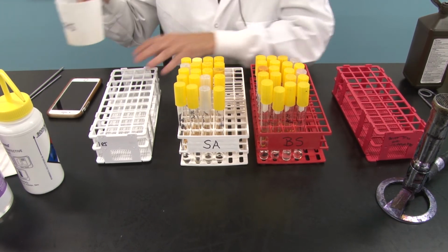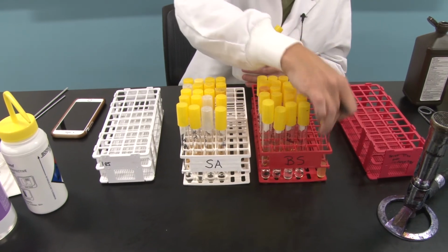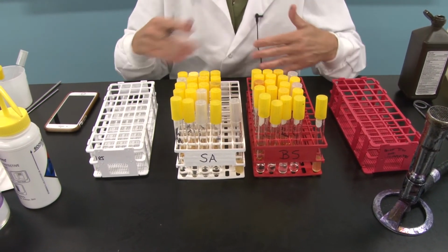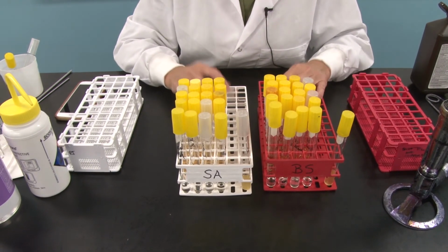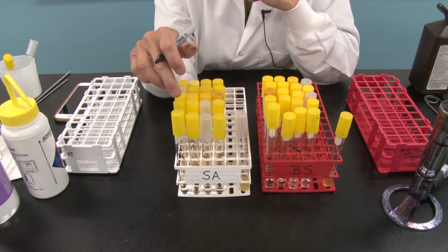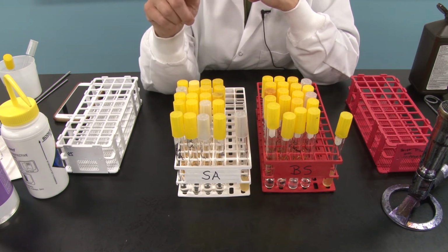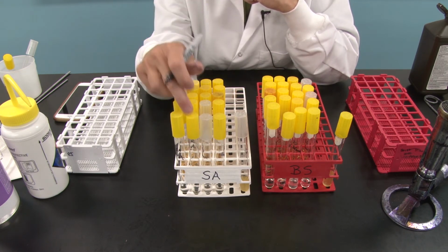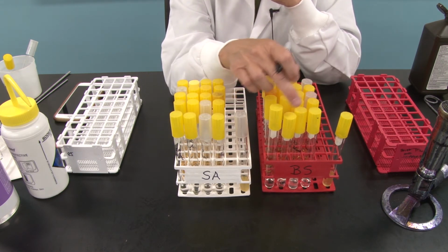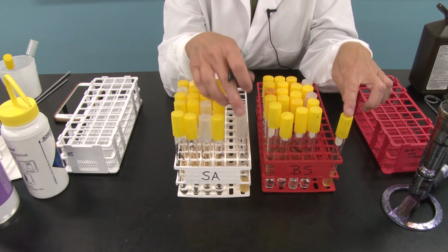Recall our stock cultures. I have Bacillus subtilis here. I'm going to put that stock right there. And I have Staph aureus right there. Now, let me tell you how this is going to play out. I am going to inoculate each of these 4 tubes, each of these 4 disinfection chemicals, with Staph aureus. I'll probably put 2 loopfuls in each of these, okay? I'm going to put 2 loopfuls of Bacillus subtilis over here in these 4, the same 4 disinfectants or antiseptics as over here, using this stock.